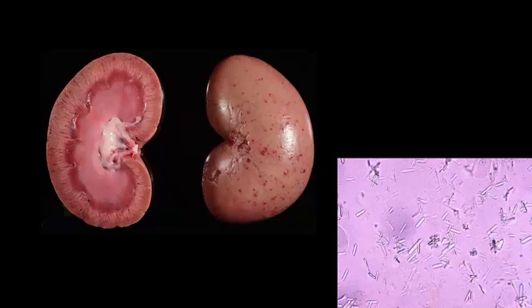Okay, this one took a lot of thinking, and some of you may have never seen a spun urine sample from one of these animals before. We have a kidney from a dog with significant white stripings and an overall tan color to the cortex. That's not a normal looking cortex. Whenever I see a golden tan cortex, I think either of glomerulonephritis or some form of toxicity.